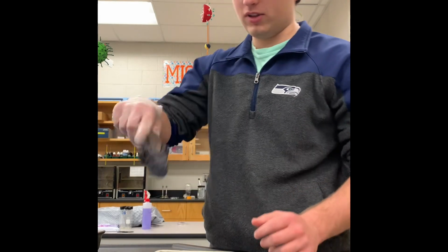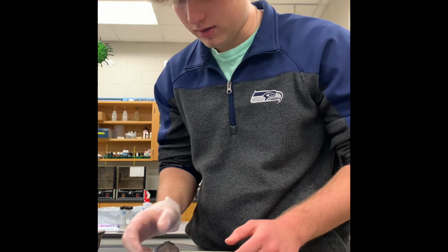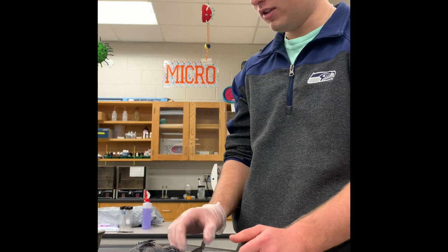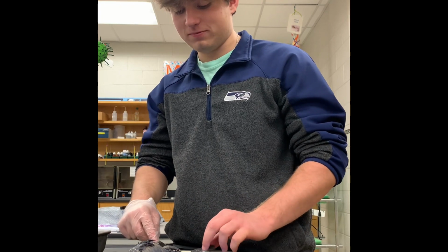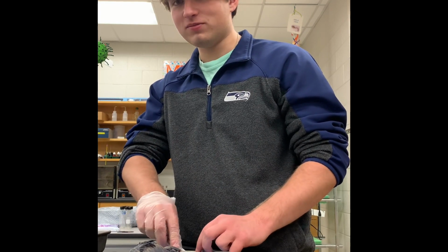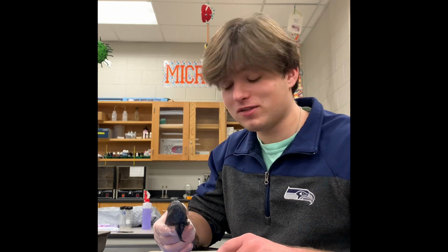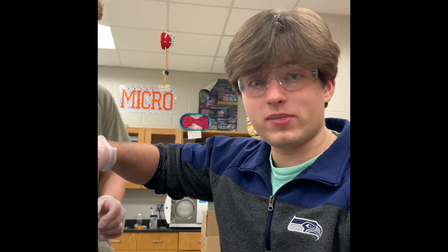All right, guys. So first, with our salamander, we are gonna take a look at it. Actually, they can regrow their tails. So we're first gonna start by cutting off its tail to see if it can regrow. No, just playing, guys. You want to pin him down, put his legs in? All right, guys, we're gonna pin our salamander down and we're gonna start to turn him out. All right, so now we are going to start to make an incision. We're gonna open up his midline.